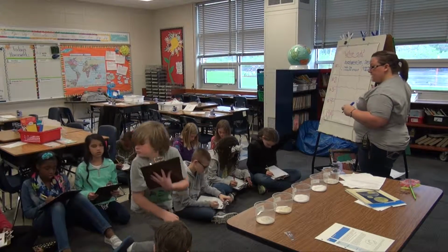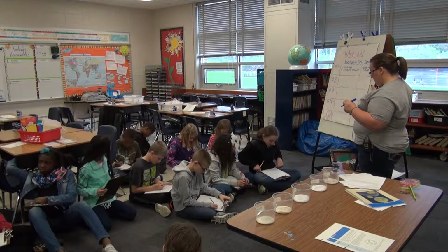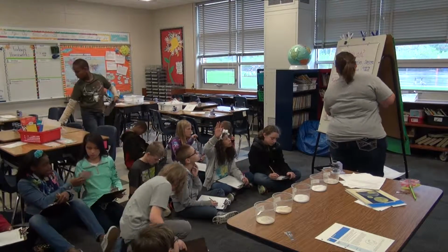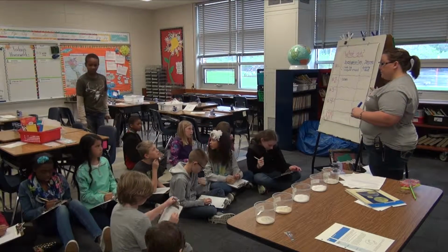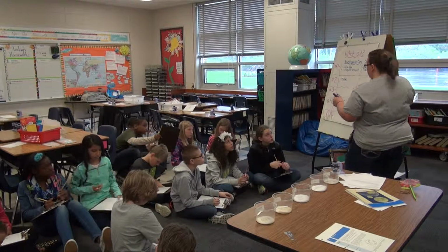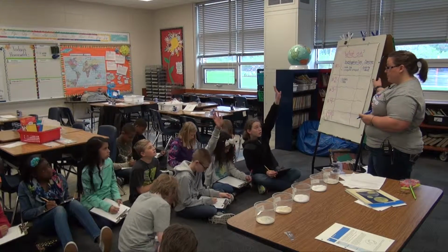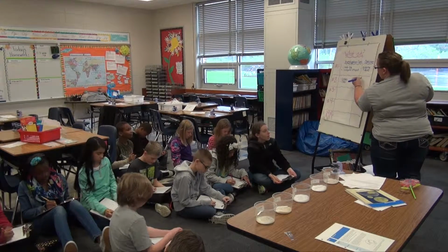How about number 2? Slide number 2, Liana. Okay. They look like cubes. Okay, they were small cubes. Wait, so Miss Laverne, change our prediction. No, do not change your prediction. Michaela? They were clear. Did you guys all get to see number 2? That one's the hardest one to see. So what do we think it is? Liana? Table salt. Table salt is correct.